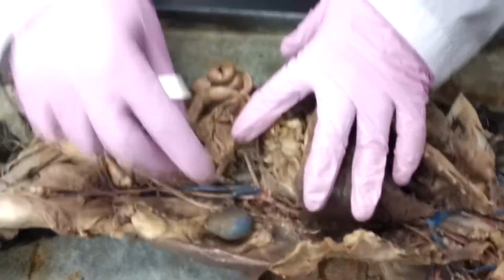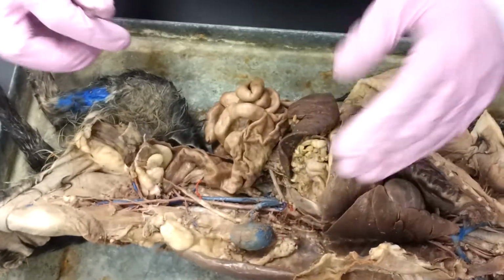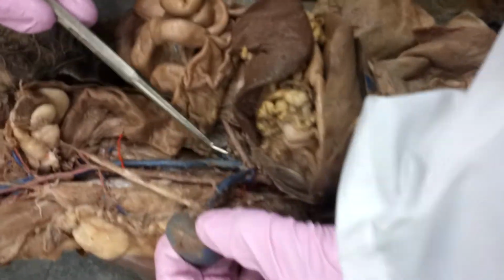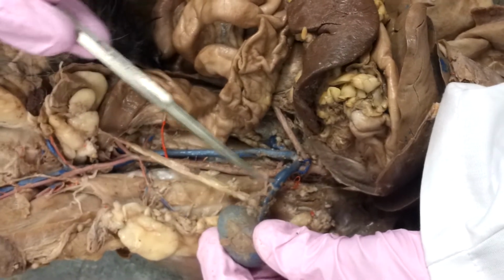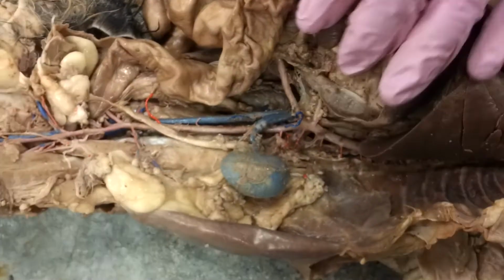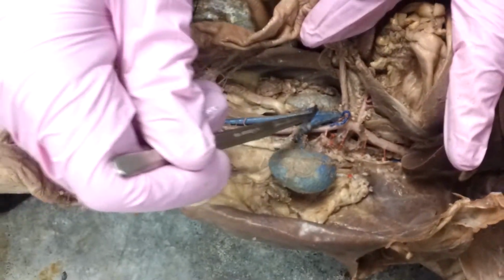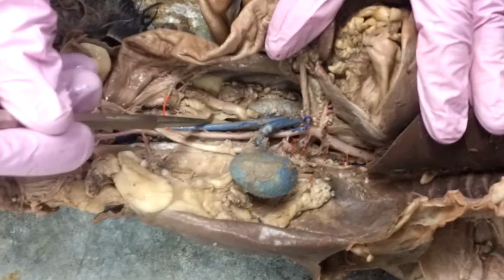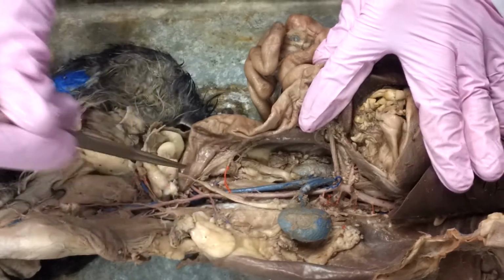When we go back to the veins and start going to the lower body, one of the easier ones here, and one of the nice things, is using that pull test and seeing that renal vein going to that kidney. Really nice picture there. What's this large vessel, which would be similar to the descending aorta? Well, that's going to be our inferior vena cava. So our inferior vena cava is going to go down.